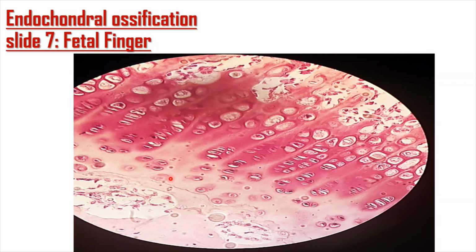How do you know that this is hyaline cartilage? Because it has a glass-like appearance, where you have lacunae, and inside of the lacunae, you've got your cartilage cells that are called chondrocytes. Hyaline cartilage, remember, has type 2 collagen fibers. So that's type 2 collagen fibers.